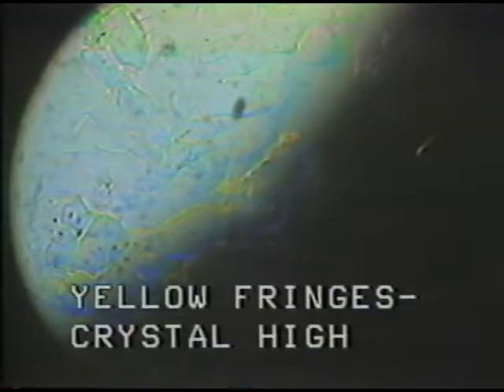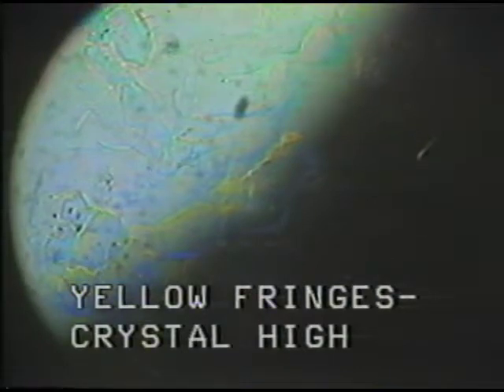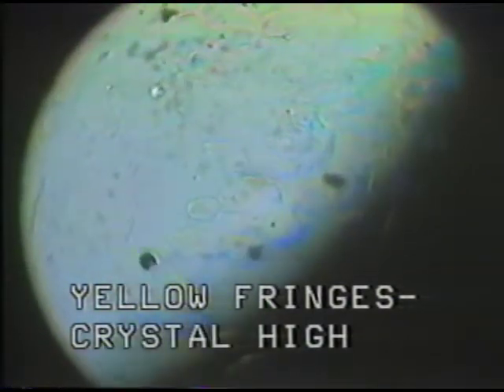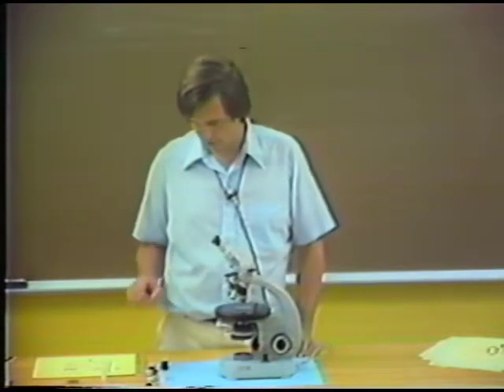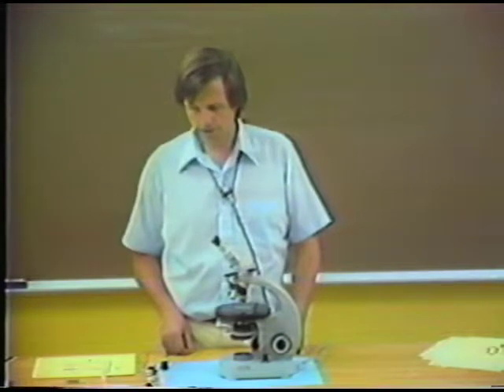There actually are also greenish and violet fringes, but if you look at the ones on the yellow to red end of the spectrum and pay attention to the character of these colors, you get an idea of how close to the refractive index we're dealing with. So in the 1.488 oil, we have yellow color fringes, and this indicates that the refractive index is very, very slightly higher than the refractive index of the mounting liquid. So we could make a guess that we'd have to change this refractive index only by a very, very small amount. These color fringes happen only when you are very, very close to a match of refractive index.